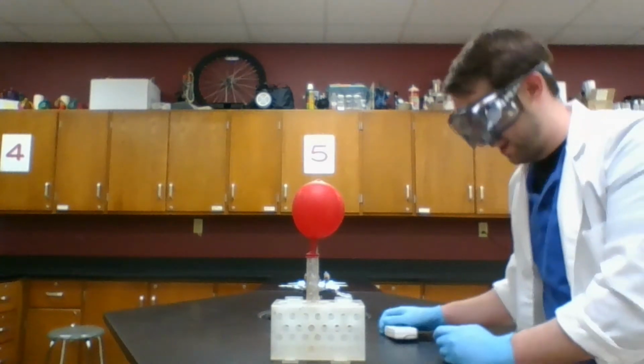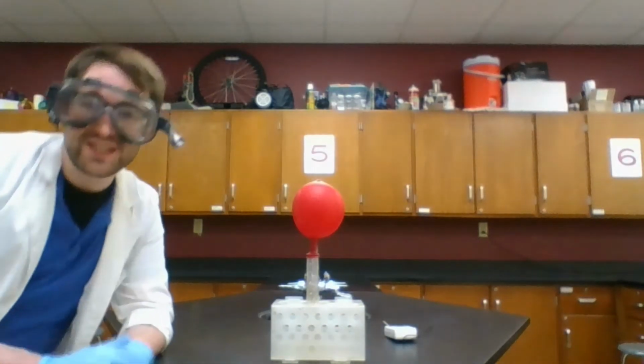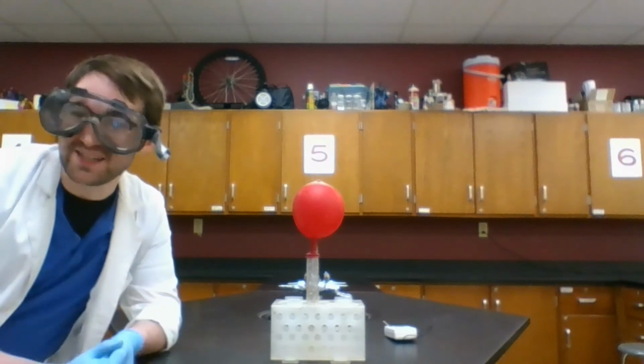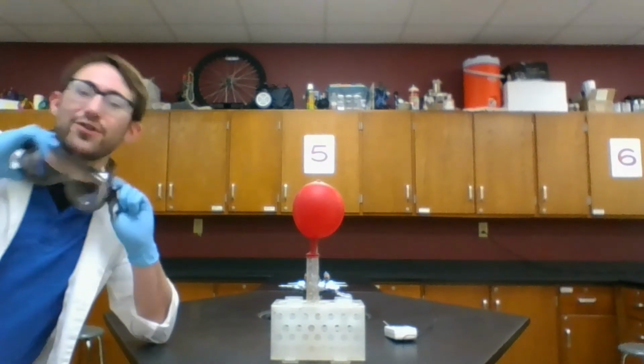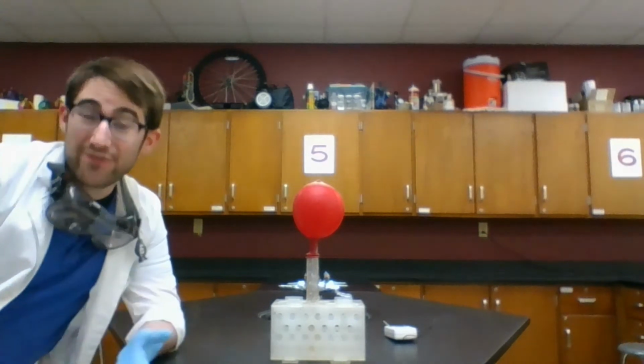It's hot. So this reaction, this chemical change, released heat, which is one way we can tell it's a chemical change. It's something we already saw as a clue. But we also have a new clue to a chemical change, which is the fact that a gas showed up out of nowhere.